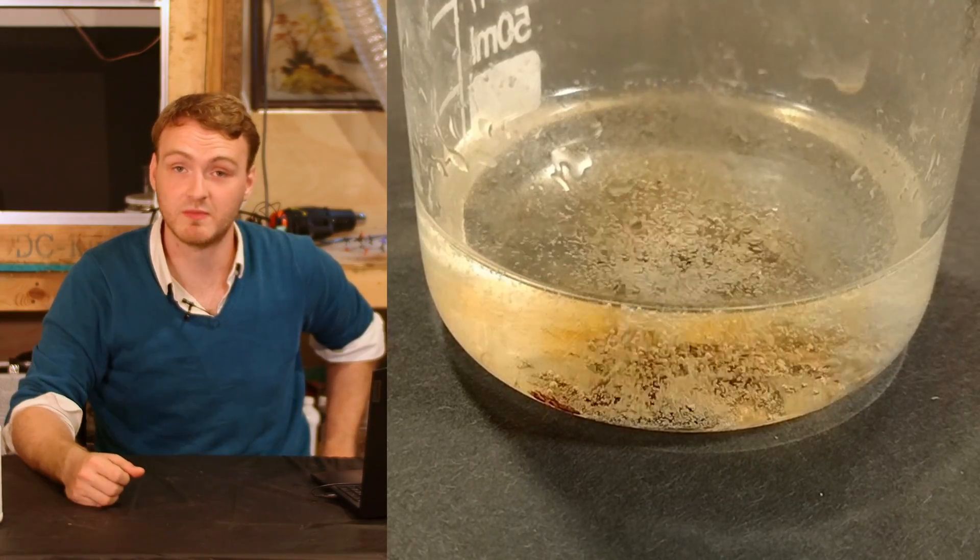So why would anybody need this? Well, I hate to throw the cold water on you, but there's some messes that Mr. Clean just can't erase. So the natural next step is to just blast the fuck out of it with acid and powerful oxidizers. If it works, it works.